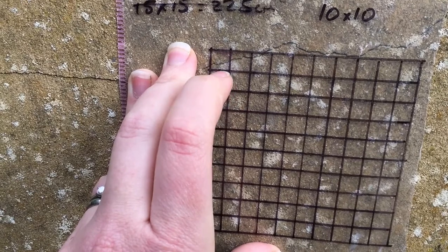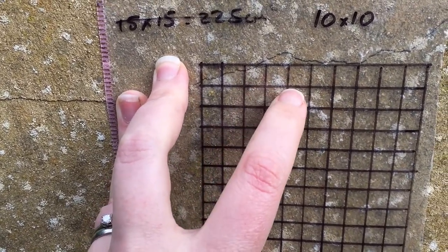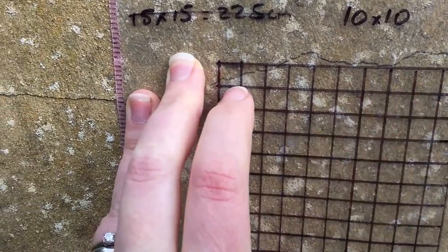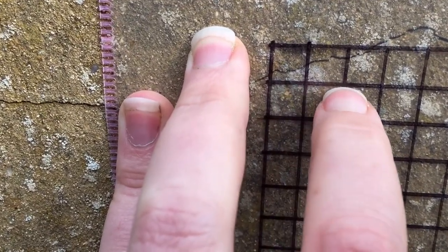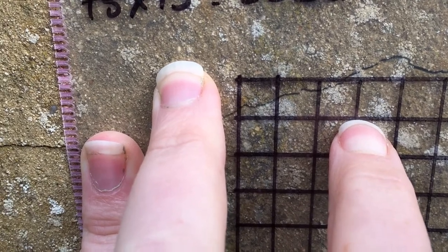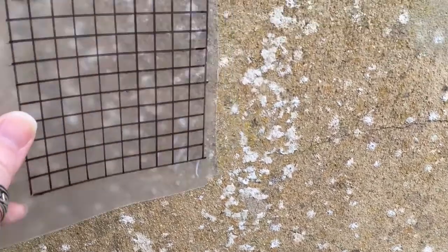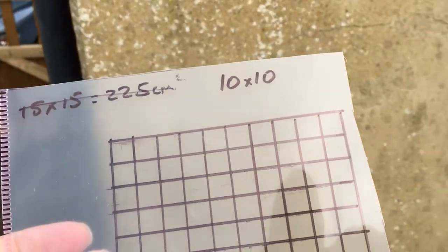But then the second part of it is, without moving that, you then want to count exactly how many of these points you will see that lichen. So you can see on this one, that's one point where you can see lichen, but that one, there is no lichen there. This one, I would say that there's lichen there because there's the tiniest spot just exactly on that point, and that one as well. So you count every individual one and see how many of them contain lichen. So it is more accurate, but it does take more time.